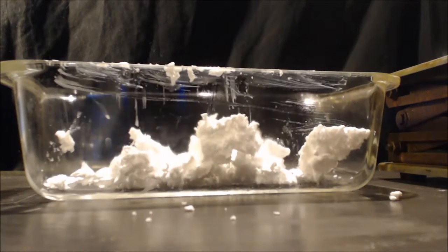Let's put it in some hydrochloric acid and see what happens. There's like zero fizzing. None. Wow, I did it.